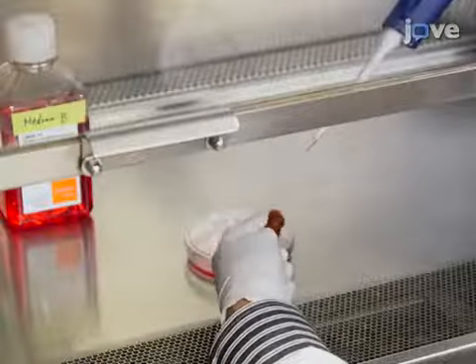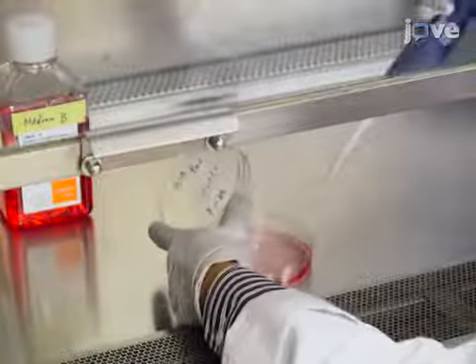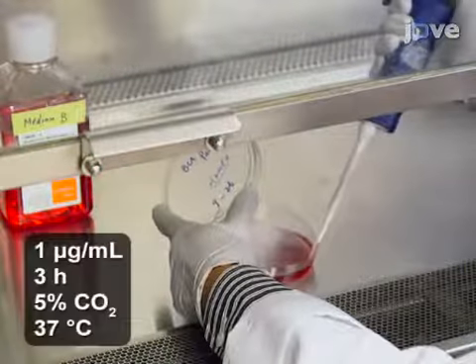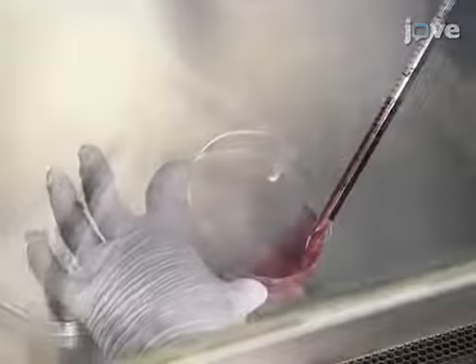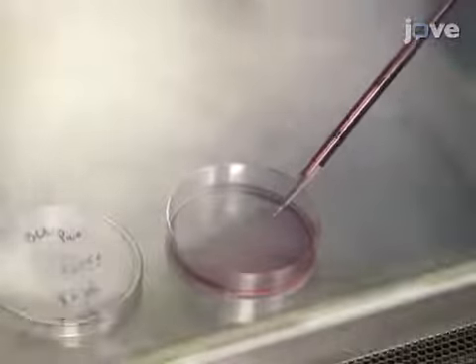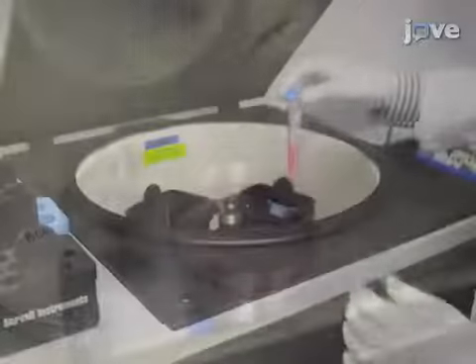Then, induce apoptosis by incubating the cells in culture medium B containing staurosporine, a non-selective protein kinase inhibitor, for 3 hours at 37 degrees Celsius. After 3 hours, collect the medium containing floating apoptotic cells that have detached from the monolayer.